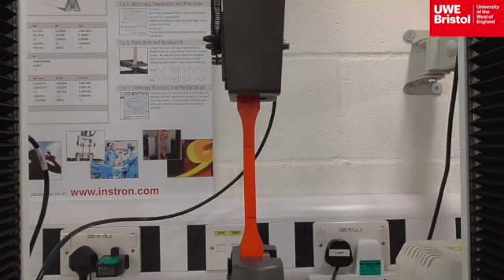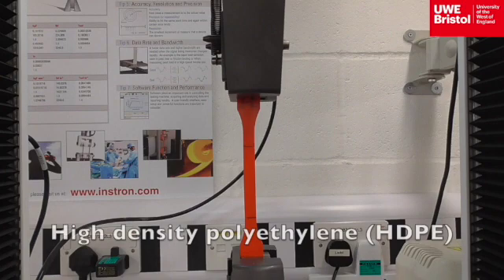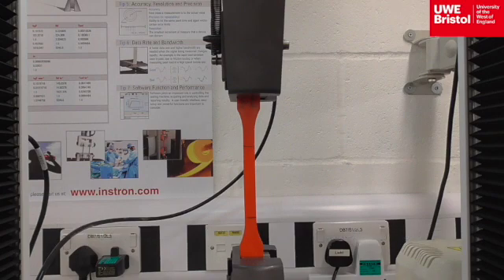This specimen is high-density polyethylene. The relevant data has been entered into the software and the rate of extension is 65 millimeters per minute. Beginning the test now.